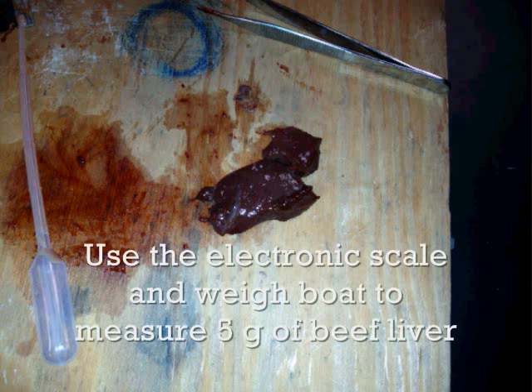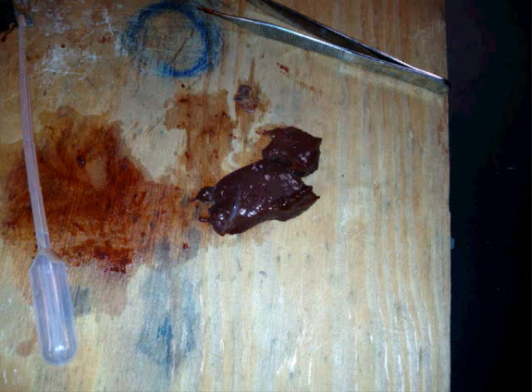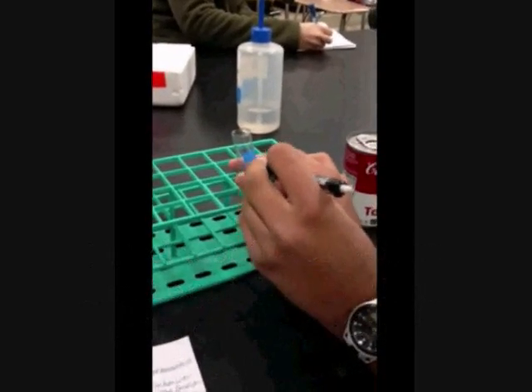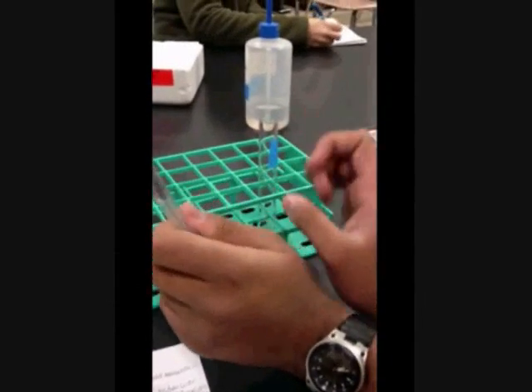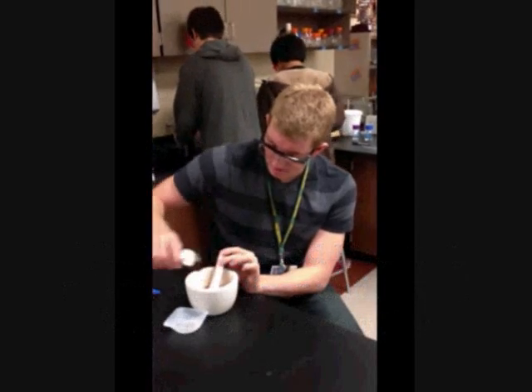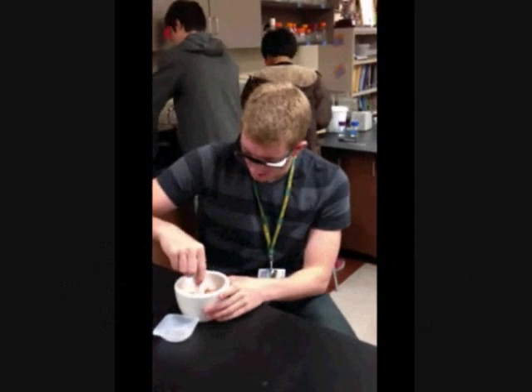Use electronic scale and weigh boat to measure 5 grams of beef liver. Label the test tubes 0 through 5 for number of drops of liver solution to be added. Add 5 milliliters distilled water and mix with the liver for 50% liver solution.